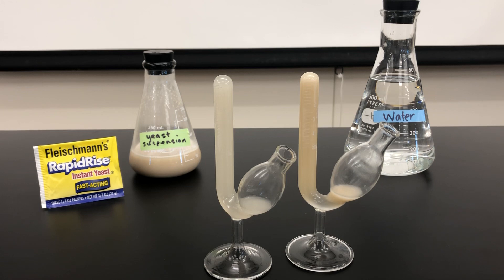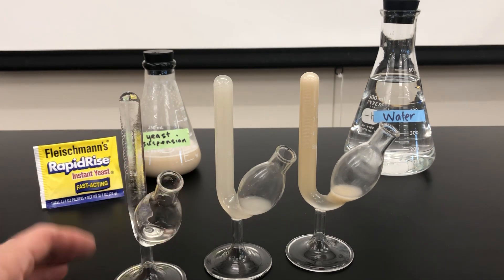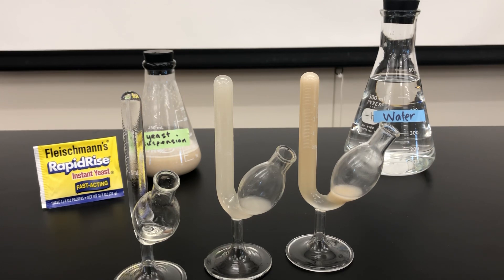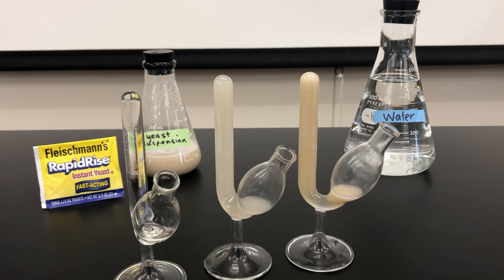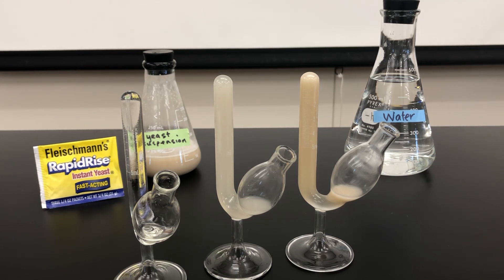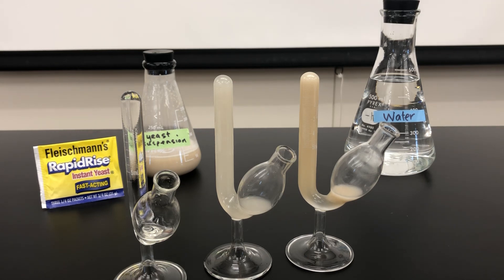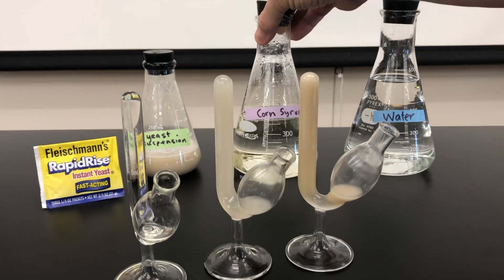If you'd like to try this at home, you certainly can do this in a bottle and you could collect your carbon dioxide in a balloon fastened to the top of it, to estimate the amounts. Corn syrup and yeast are fairly readily available at the grocery store, and you could try this on your own.